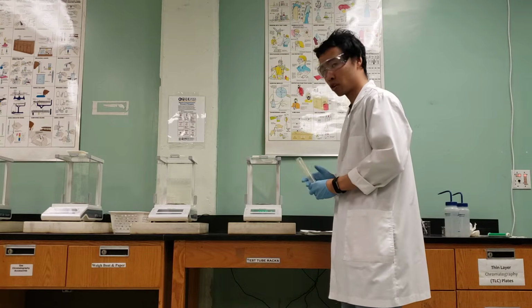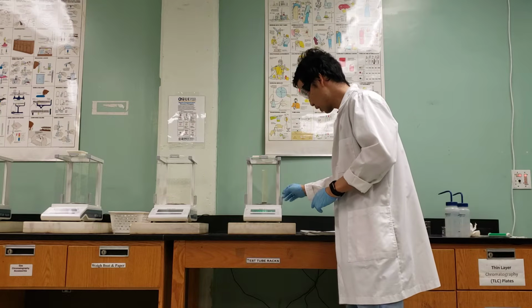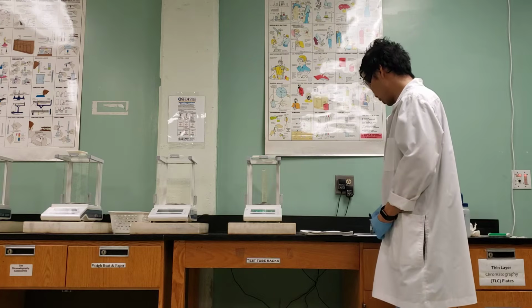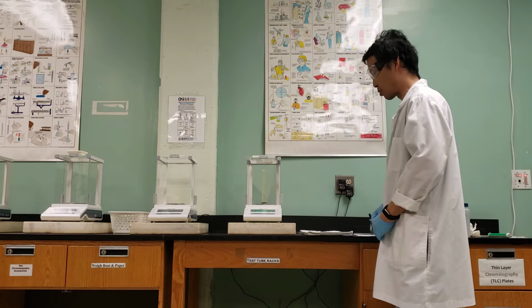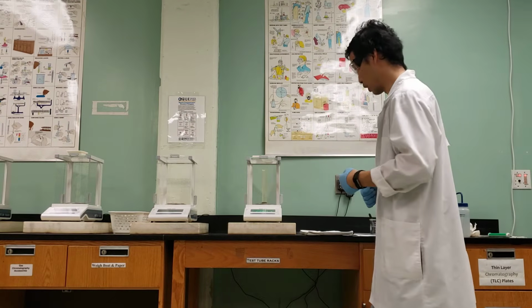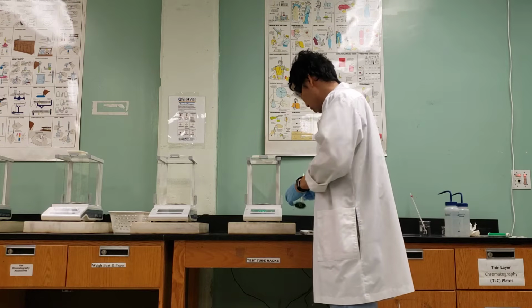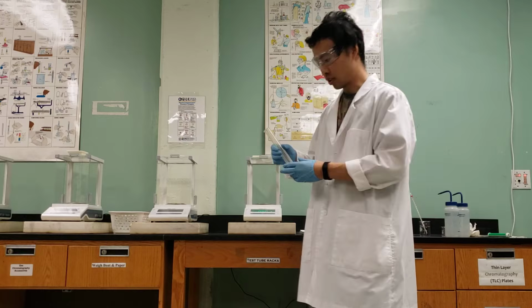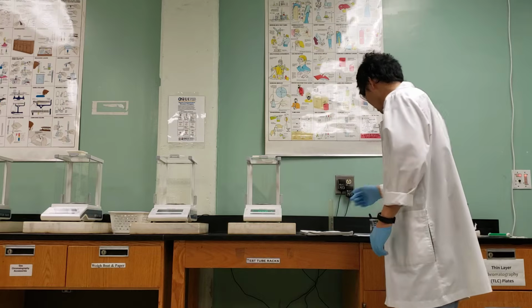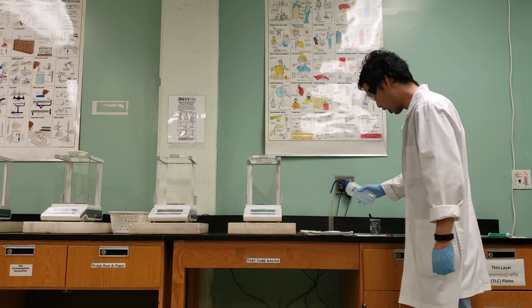You know how to use the analytical balance from last week in our introductory lab session. And here it reads 20.777 grams. You don't have to write this down now because I've already done this for you, and I will show this data later. So I measured the empty graduated cylinder. Let me just bring it up closer. This is our 50 milliliter graduated cylinder. We're going to add, as it says here in step 2, up to 9 mils.